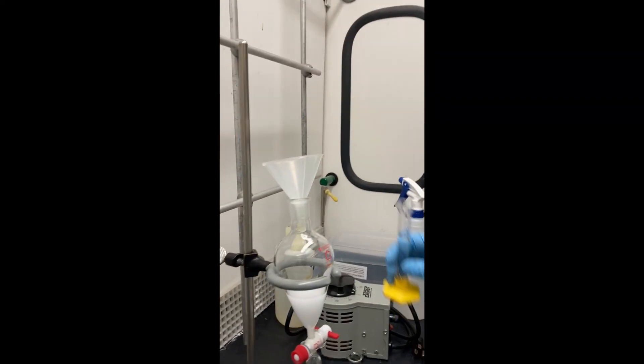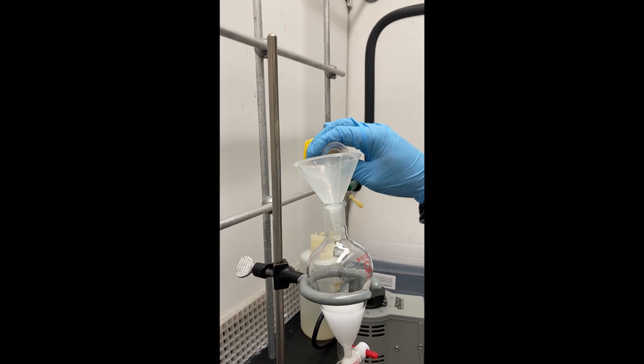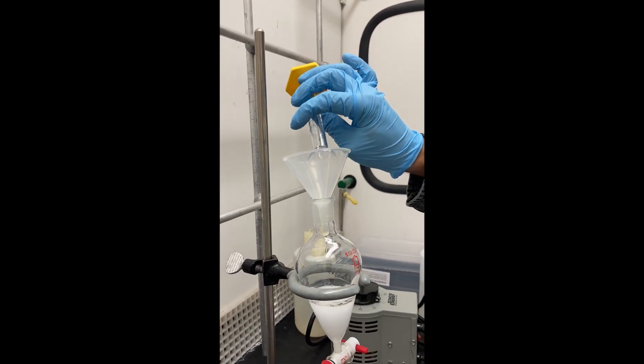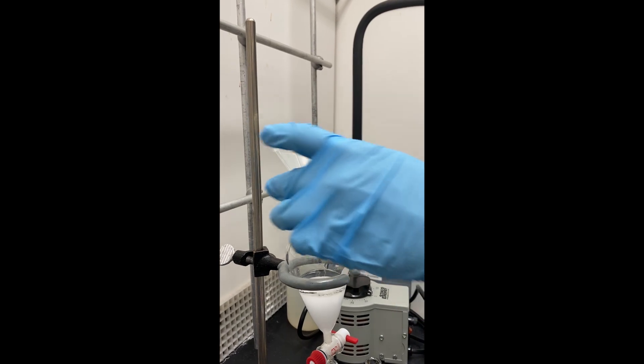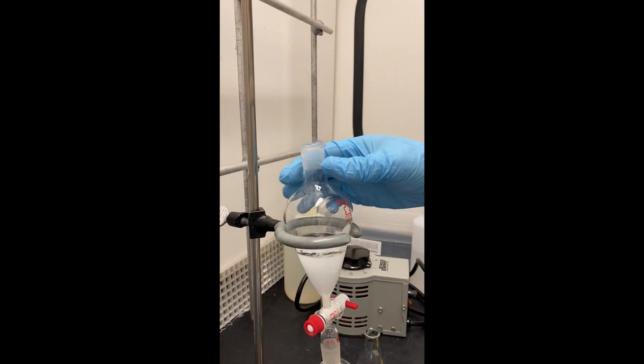Since our oils prefer to dissolve in organic layers, the goal here is to try and pull the oils from the aqueous layer into the organic. And to help do this, we'll have to mix both of these liquids together.